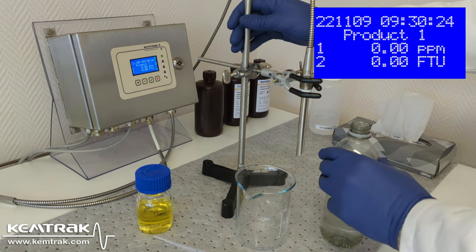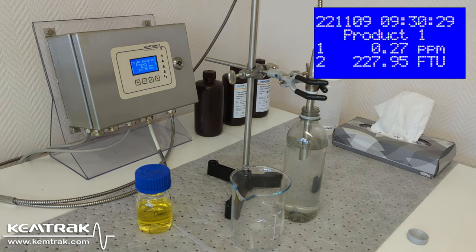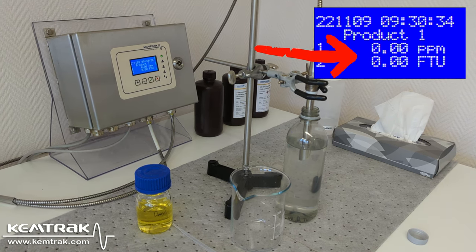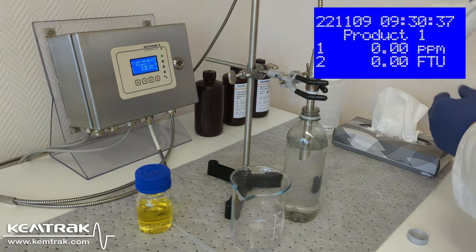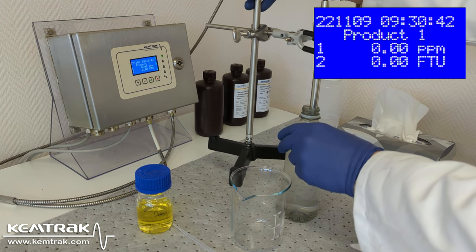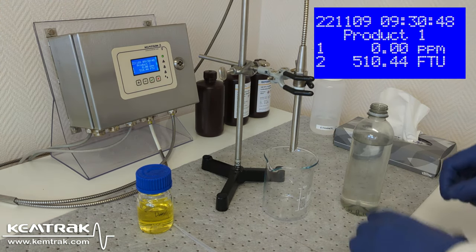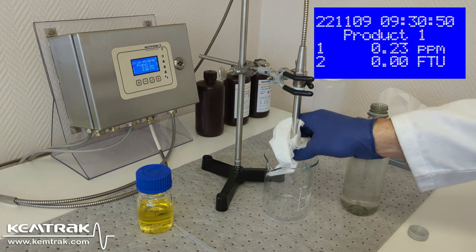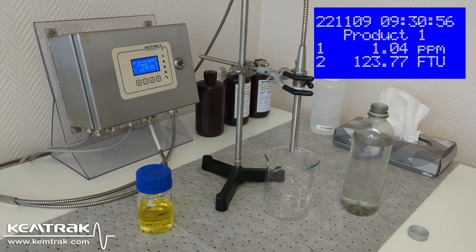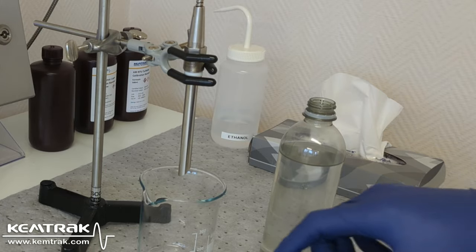I dip the probe in a bottle containing water and ensure the signals are at zero. I then add one drop of diesel in it.